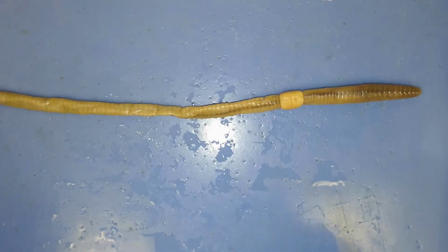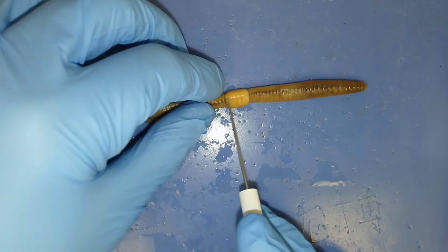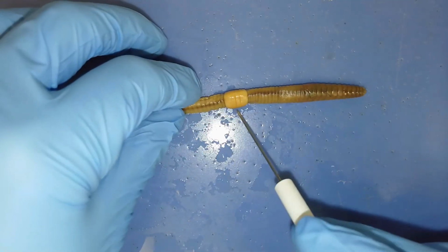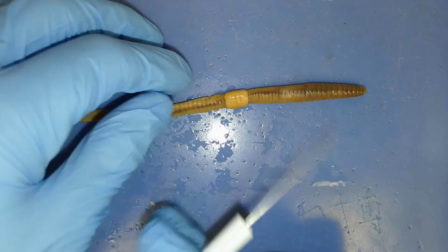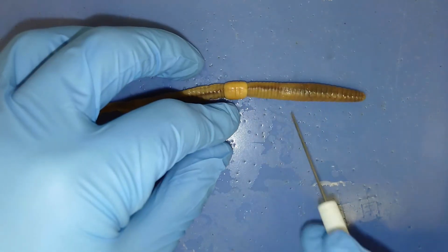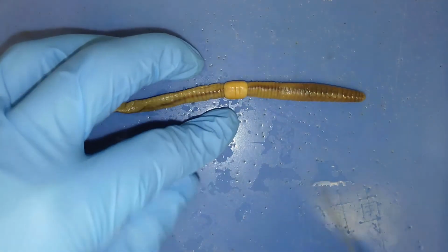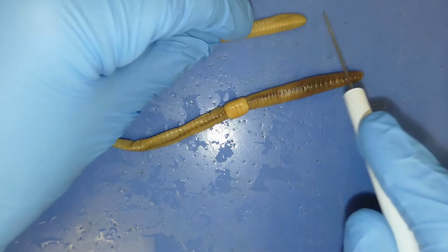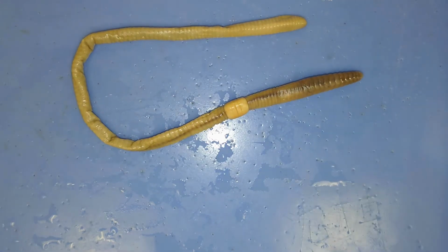All right, so I already mentioned the clitellum. This is this enlarged segment right here. So this creates the mucus ring during reproduction. That mucus ring passes sperm towards the front end, or the anterior side, towards the oviducts of this organism. There's a mouth at the very tip, and there's an anus at the other side of this organism too.